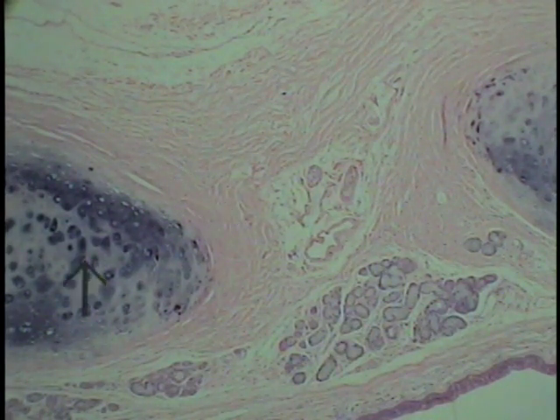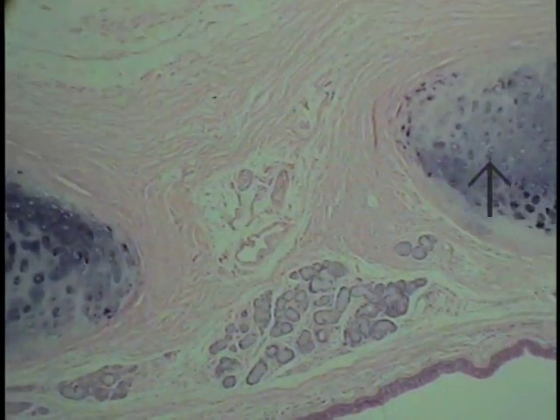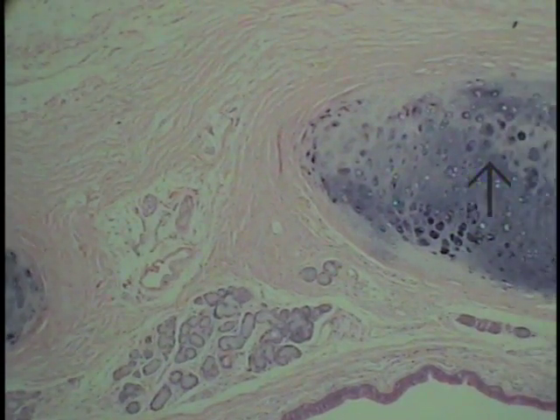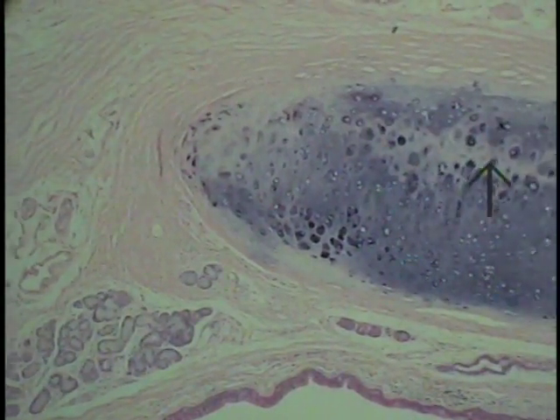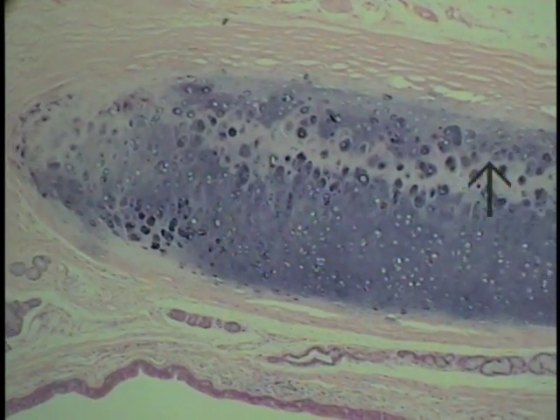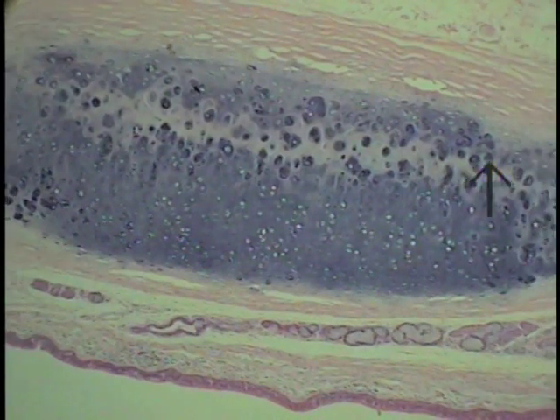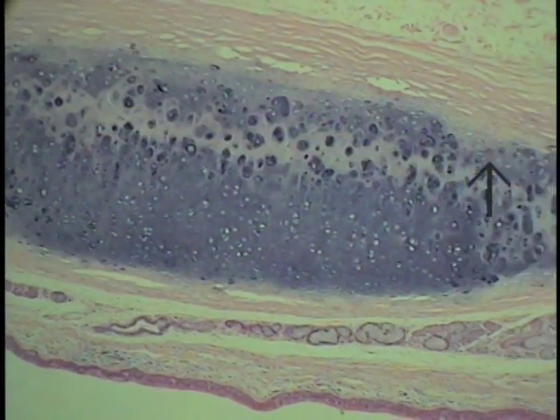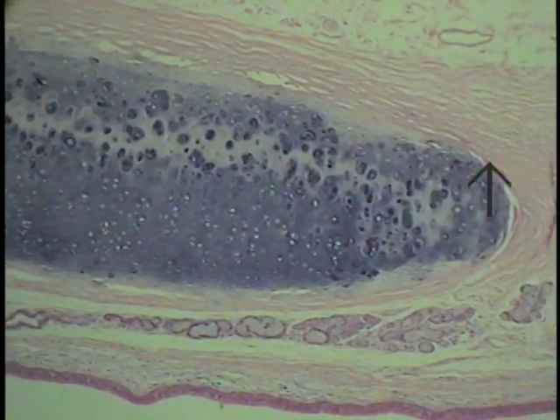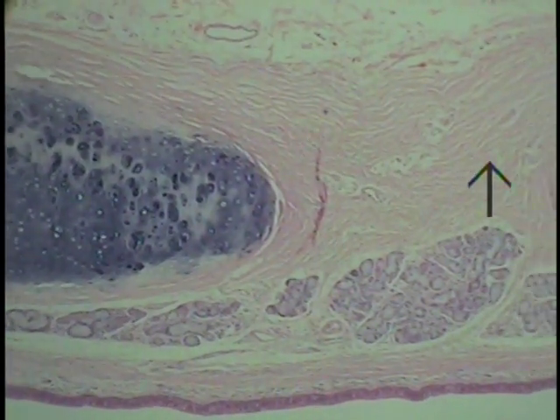Between cartilaginous blocks is a fibroelastic type of connective tissue. This is to give considerable flexibility to this particularly large airway that lies in the neck, of course, allowing the head to be turned so it can have some degree of flexibility and wouldn't be a rigid structure. The other advantage to having hyaline cartilage, of course, is its lightweight nature, yet is very, very rigid.